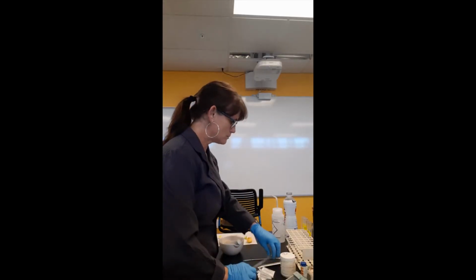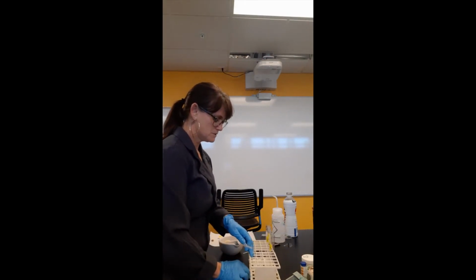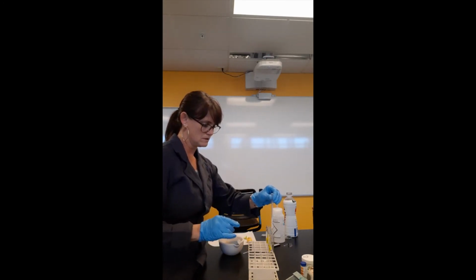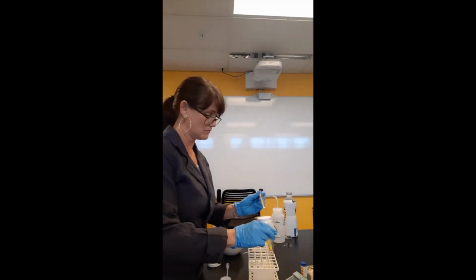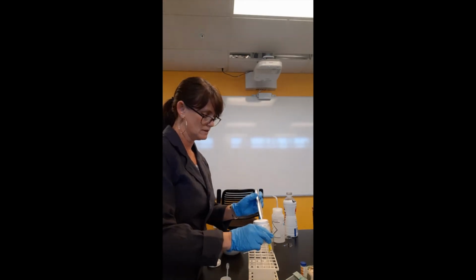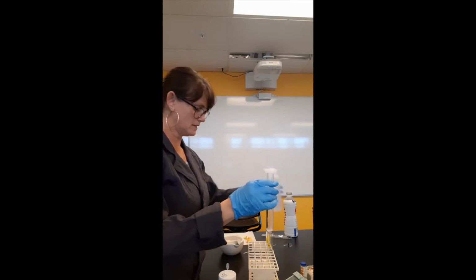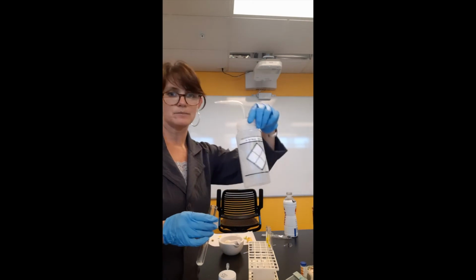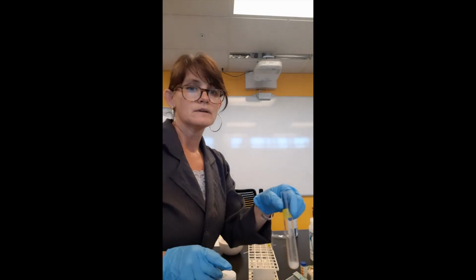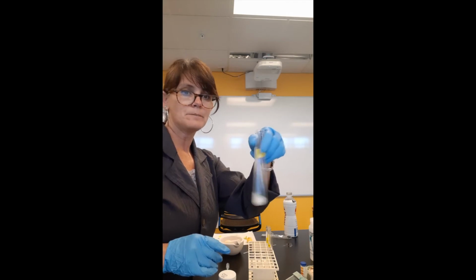I am going to follow the protocol in your course, which asks me to take 5 drops of milk and a small amount of calcium oxide, so I'm just taking a little bit on my scoopula, and give it just a tiny bit more. I'm using distilled water, so if you have trouble with any of your results, it's a good idea to pick up a jug of distilled water before you start working at home. I'm going to swirl my sample.